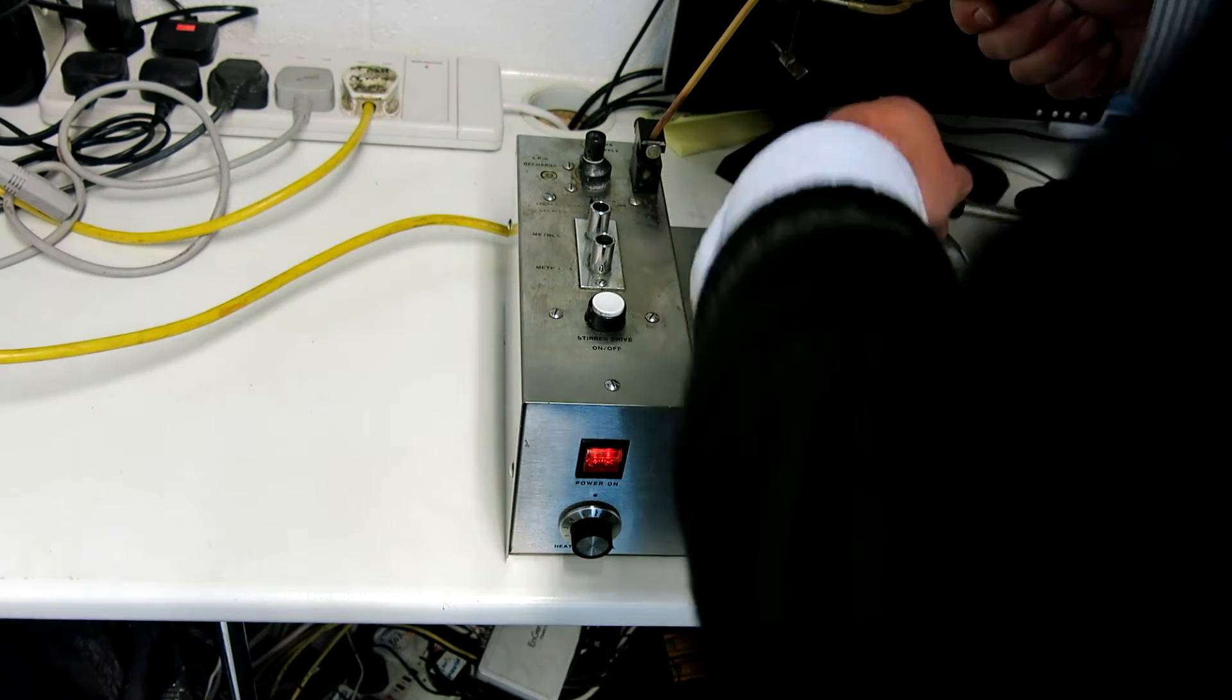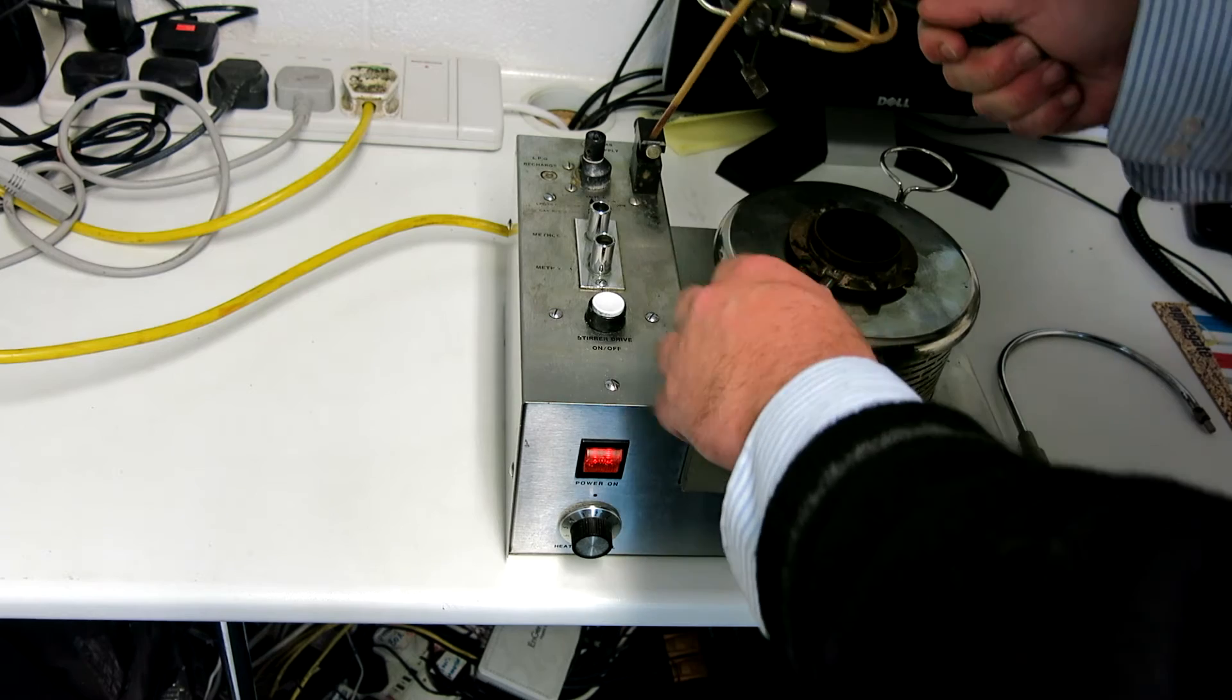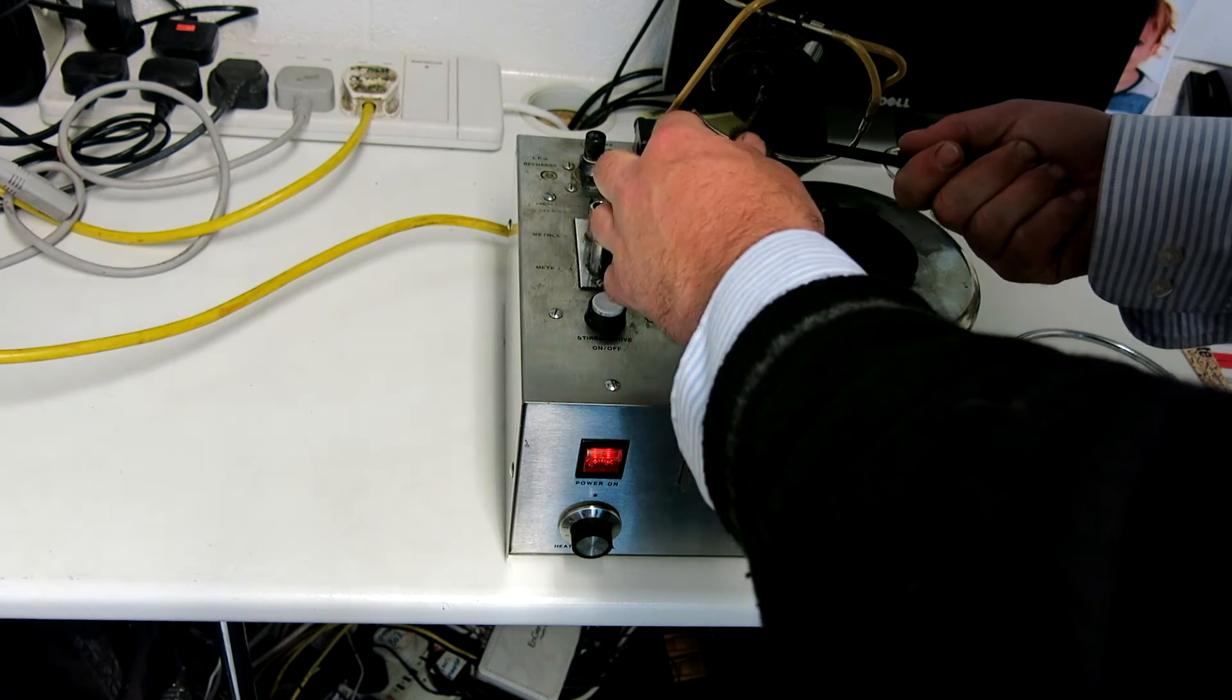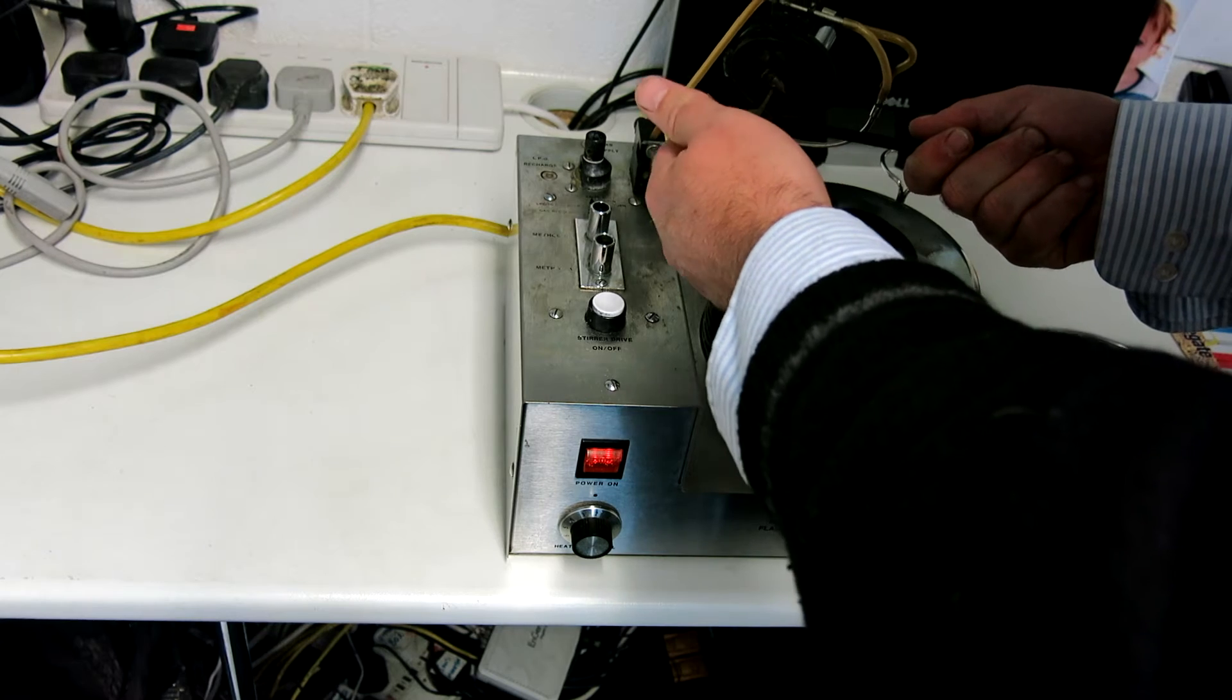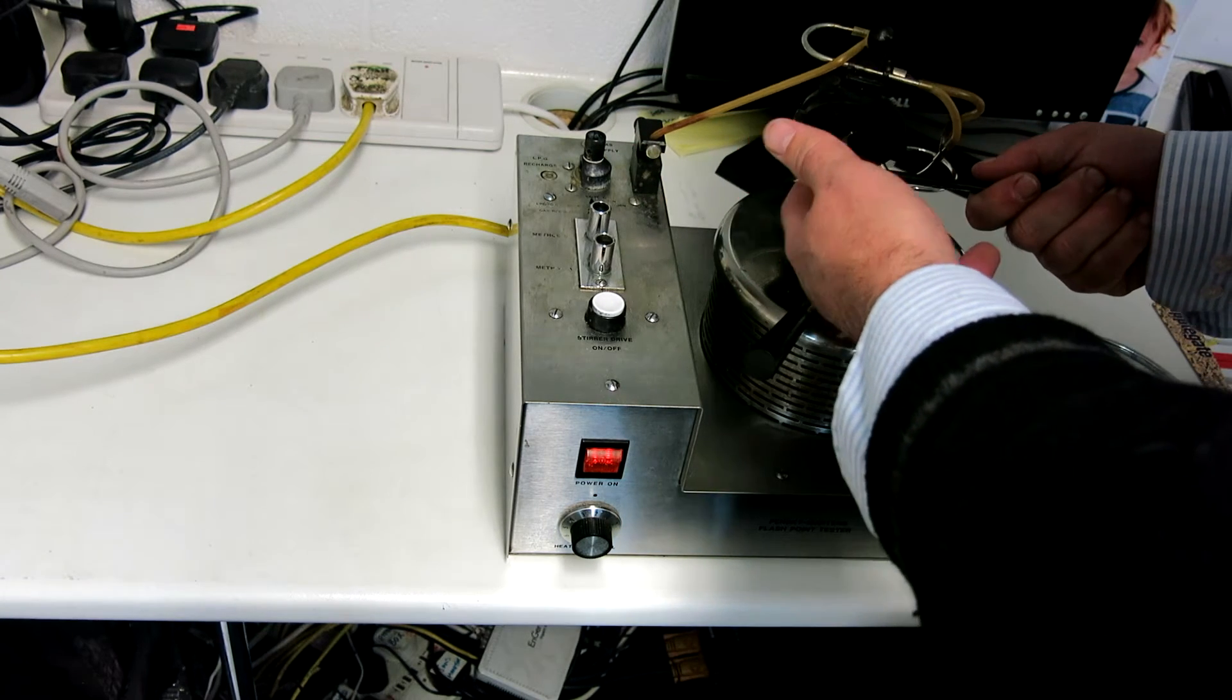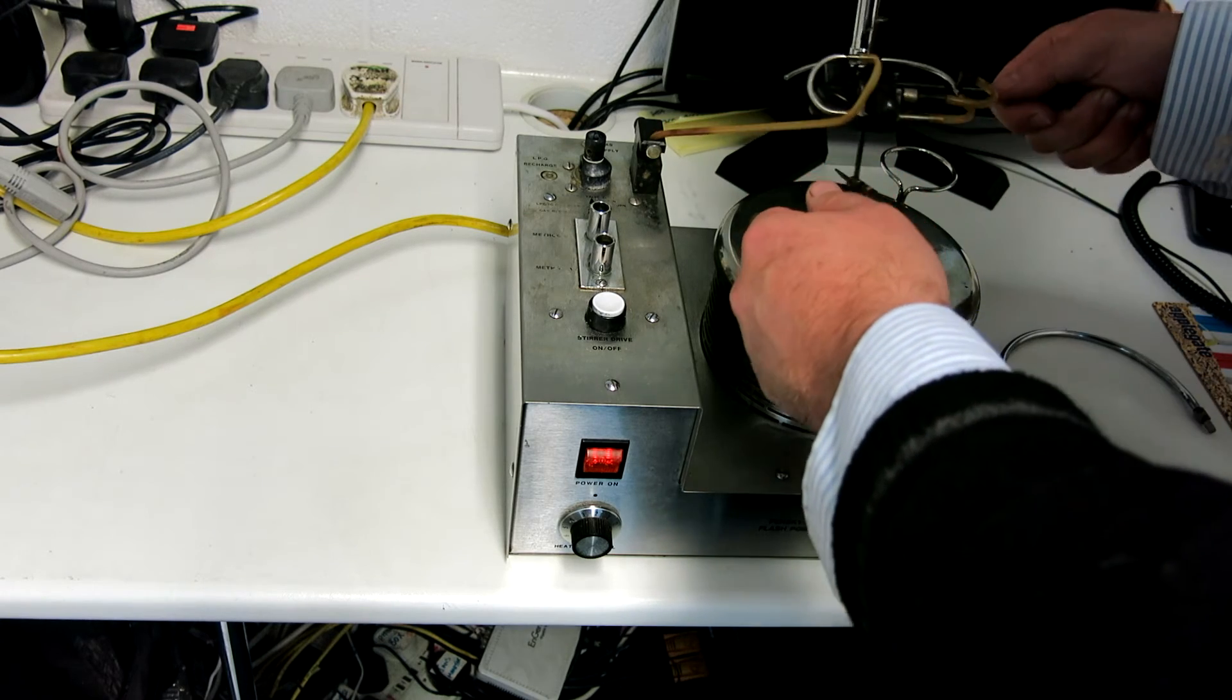That's happily heating up there. I'm not going to put my finger in it, but I can tell you now that it's pretty hot in there. Okay, so we've got the impeller here which is straight and is in good order. That's spinning freely. It's not running eccentrically or anything like that.